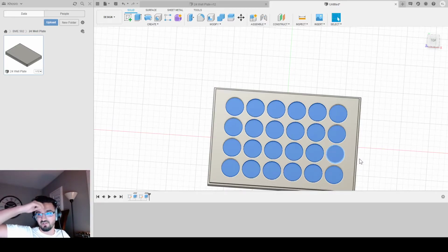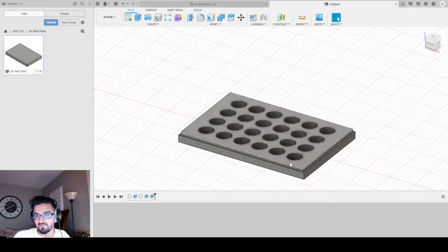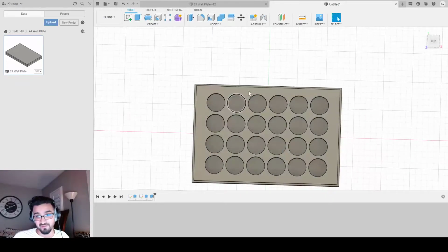I need to go down so there's 1 millimeter left from the bottom of the well to the bottom of the plate. So in that little space gap, there needs to be 1 millimeter. So 6.8 up minus 1 is 5.8. So all I gotta do is extrude negative 5.8. And now I have a 1 millimeter surface before the bottom of my well touches the bottom of my plate. There you go. You have 24 wells. But we're not going to stop here.